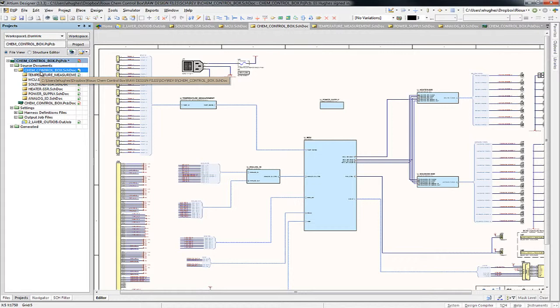Now the driver code that's going to be given to you will make it such that you shouldn't ever actually need this schematic, other than if you're trying to wire up things to the external connectors. And I actually summarized all of that in another spreadsheet file that we can take a look at later. But I'm just showing you this for your own reference.